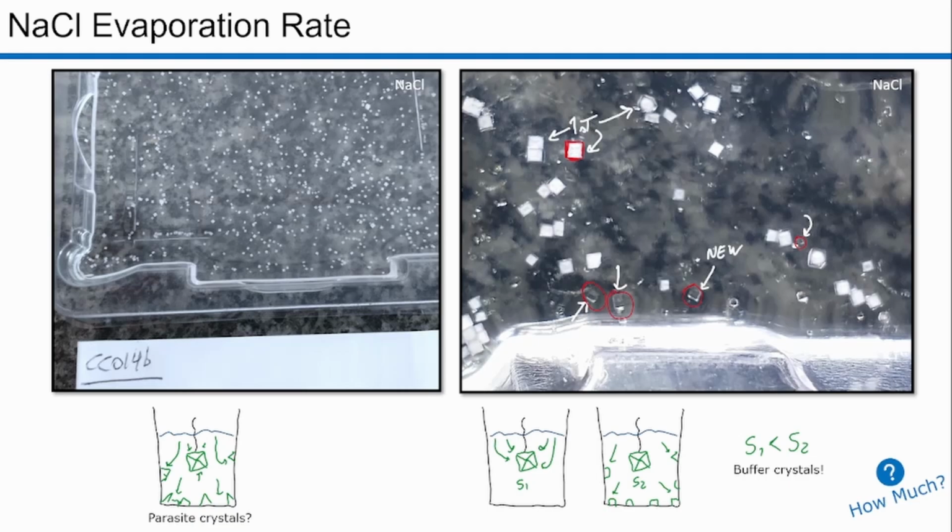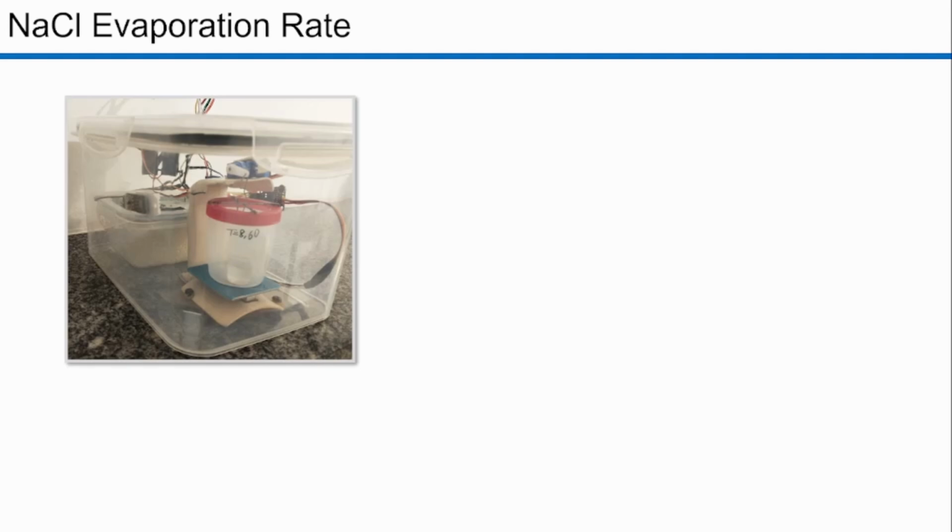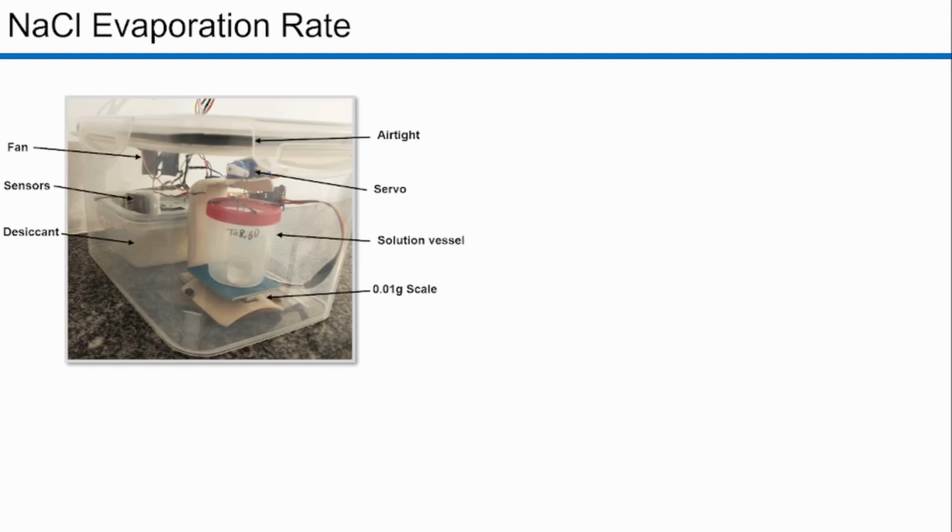And again, you might remind me that we got to this part of the video to think about how much is a fast or slower evaporation. So I made this scheme, this apparatus, to weigh the crystal evaporation. I have an airtight container with a servo and a solution vessel over here. This is a scale that I made with a simple scale, and in this environment we have a fan to uniform the air, some temperature and humidity sensors, and a desiccant, which in this case is silica gel. These things are controlled by the Arduino, and I think on sharing it in the future.